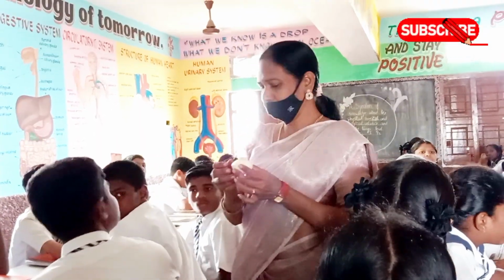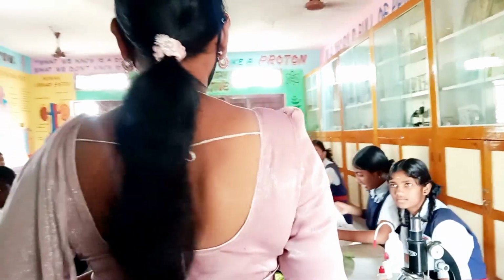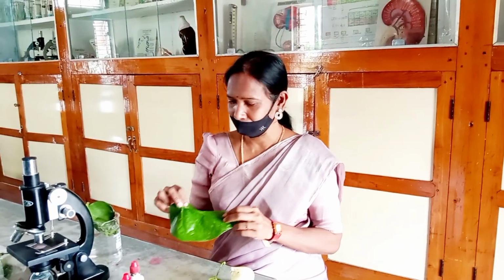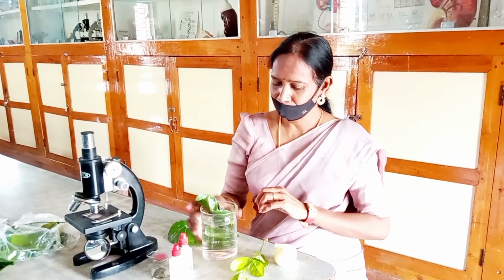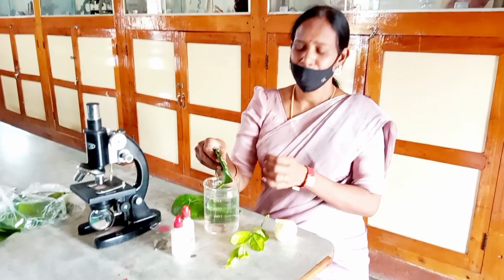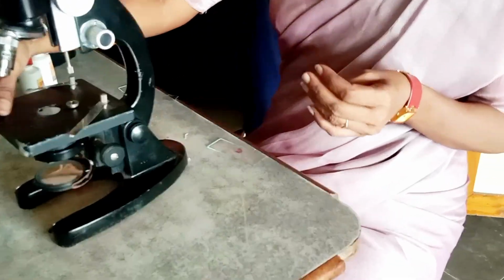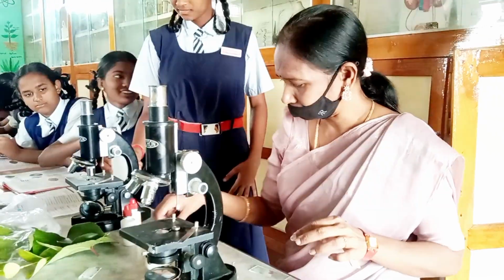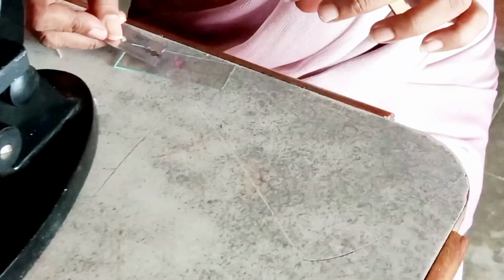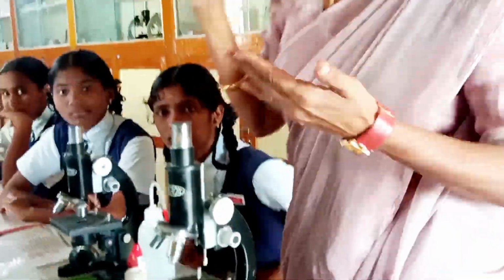Later on, I explained about stomata and dermal tissue, which can be collected by tearing in a single stroke from piper betel leaves to observe under the microscope. In the same way, a hydrophyte which contains aerenchyma, which is a kind of parenchyma, then they were much more excited. Then I mounted all these materials using glass slides, glycerin, cover slips, etc. and arranged them under the microscope so that they started observing one after the other in their respective queues.